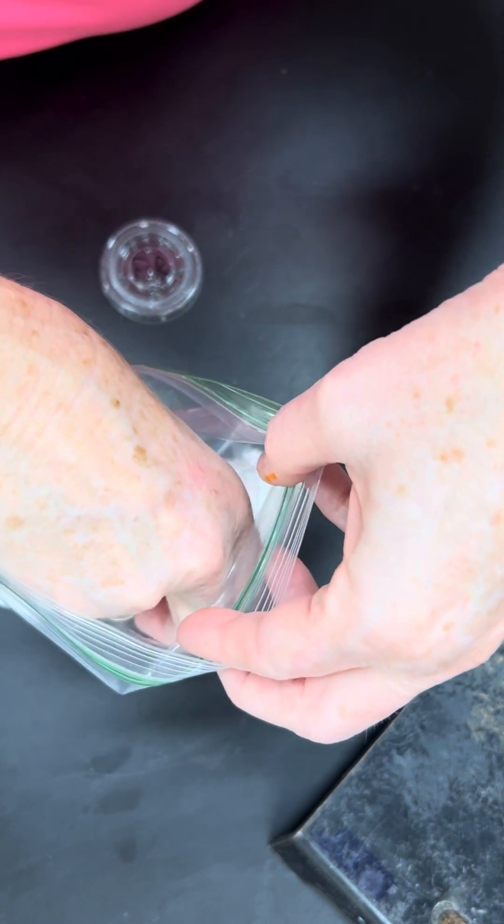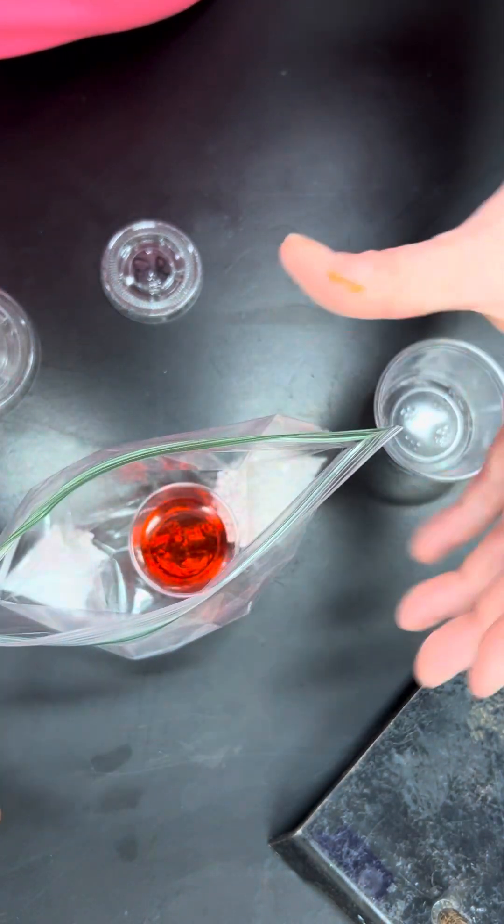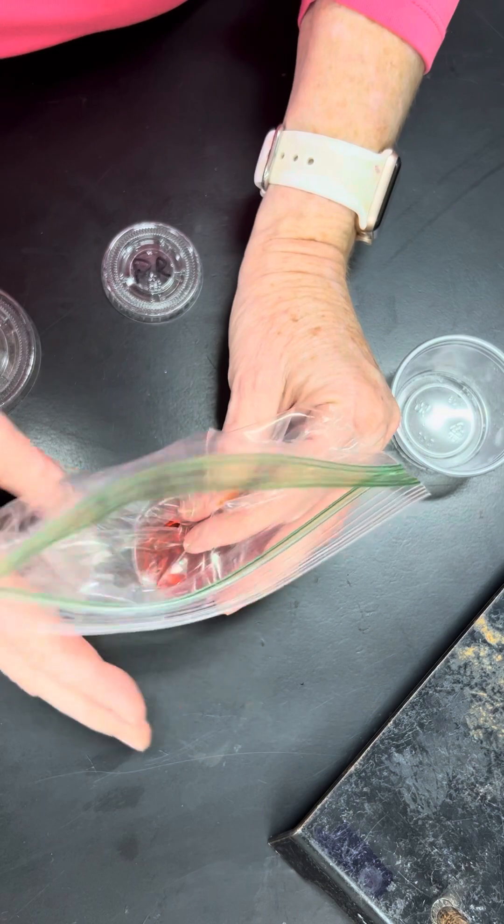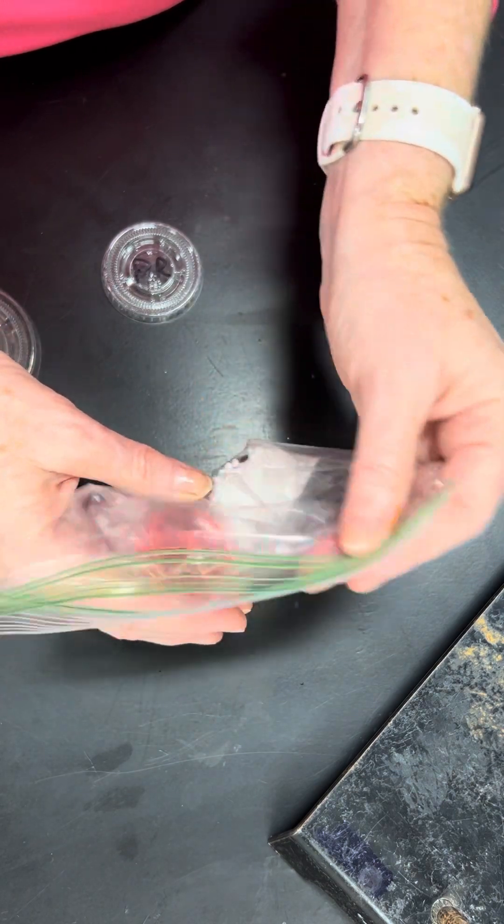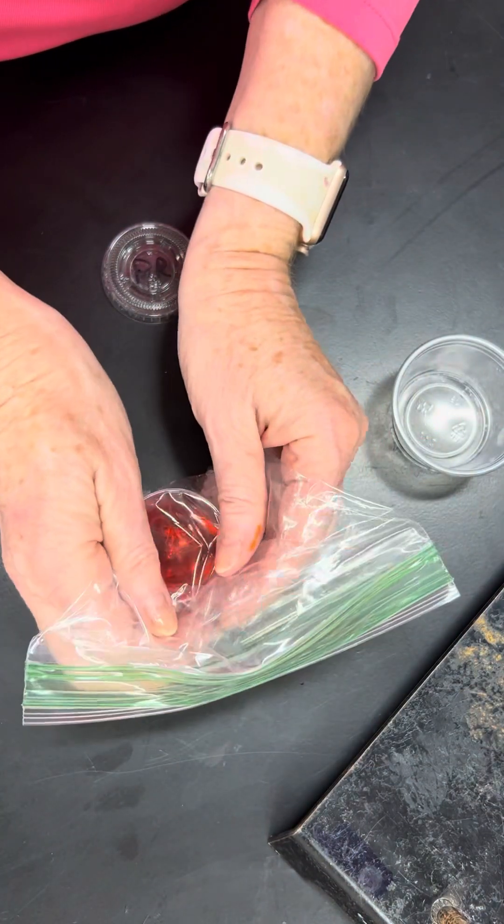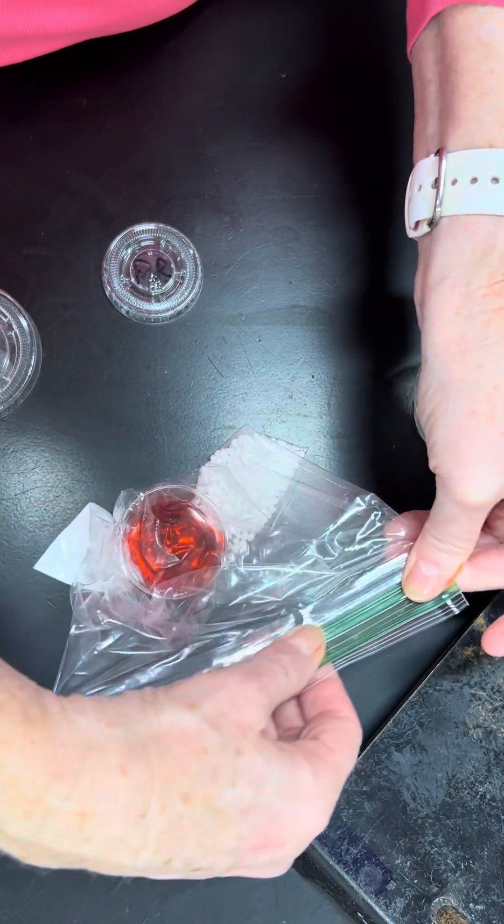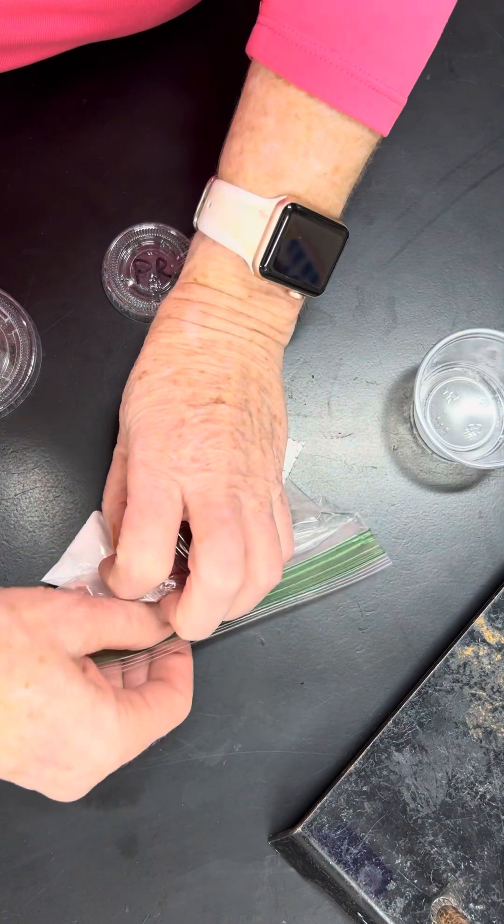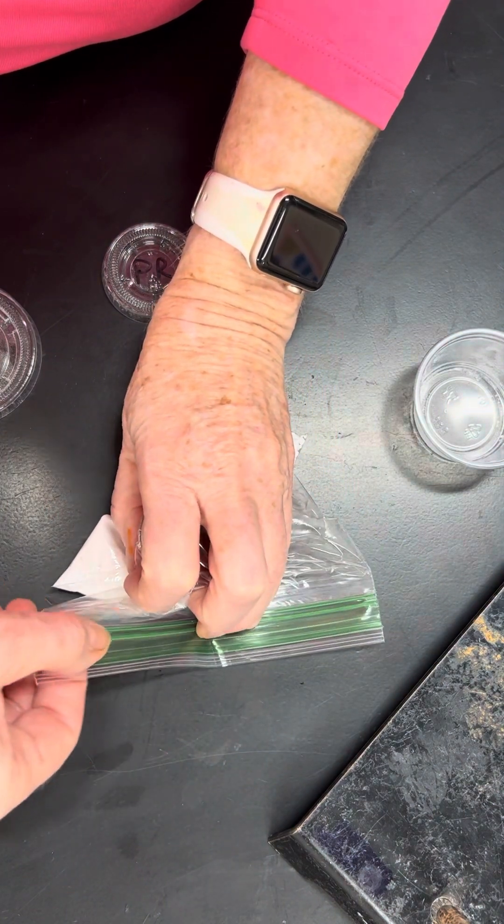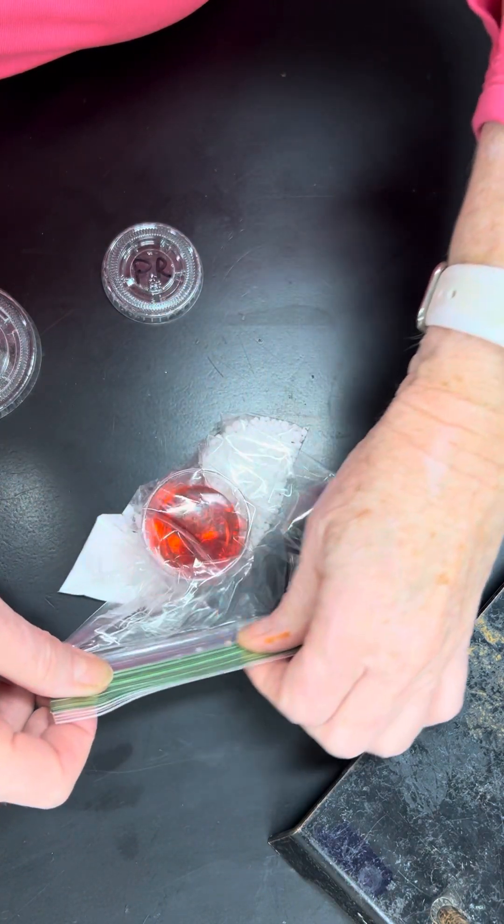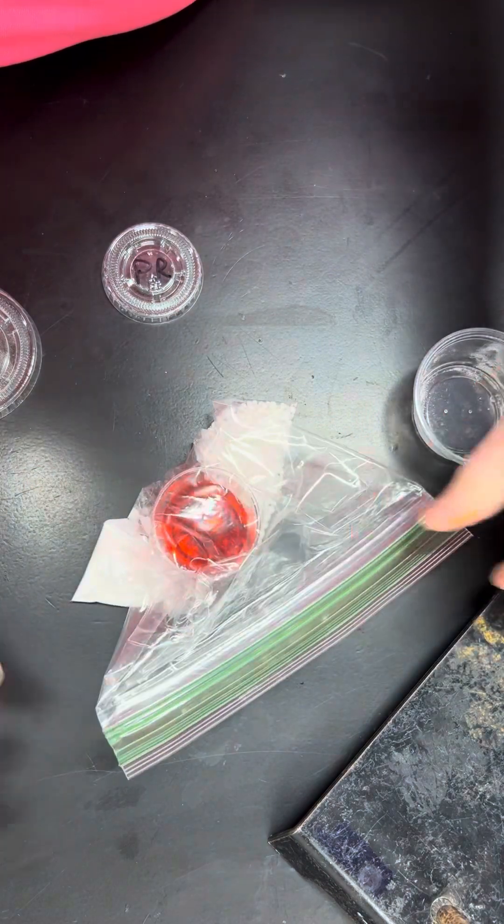We're going to try to keep them separate. We're going to put the liquid container in the center and get as much air out of the bag. This is kind of important, and you'll see why in a minute. Squeeze as much air out of the bag without knocking over the liquid container. This is very hard to do with one person, but there it goes.